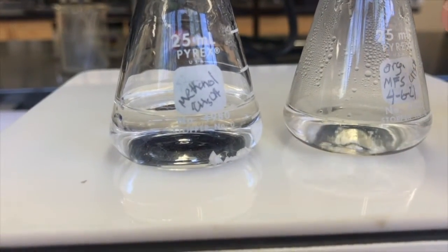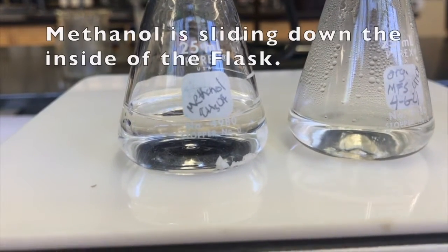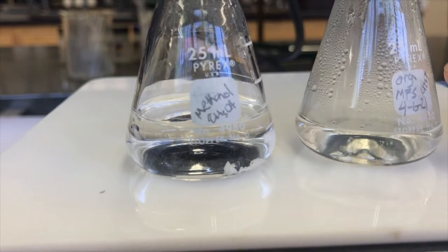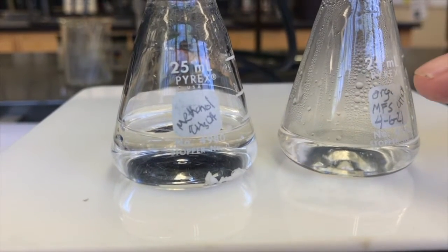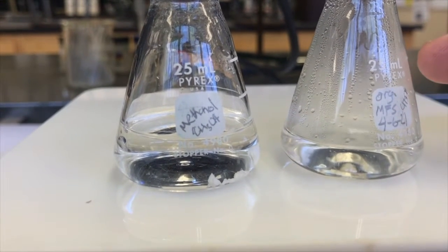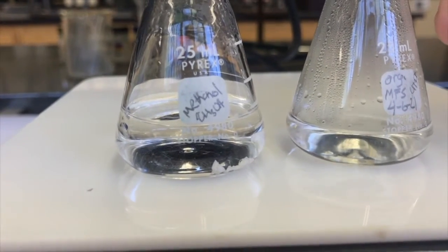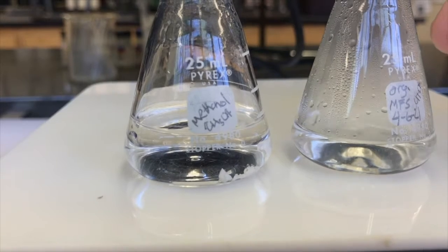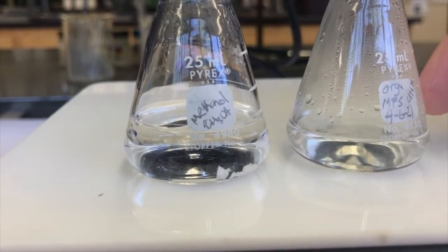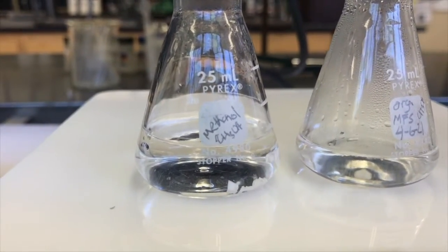See how the drips of methanol slide down the outside of the flask? The outside of this flask is acting as what we call an air condenser. So the liquid methanol is evaporating, the gases are hitting the inside of the glass, which is cooler, and then it condenses from gas back to liquid and drips down. This outside of this flask is cooled by air, so we call it an air condenser.